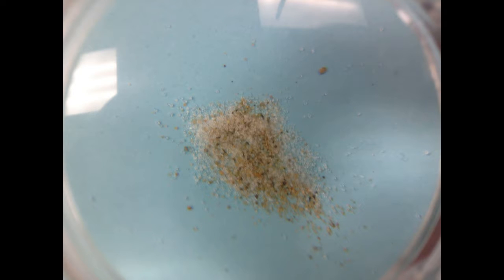And finally, here is the combination of NaCl, or sodium chloride, and sand. Please again jot down any observations you have and finish up the particle picture box with this final particle picture.